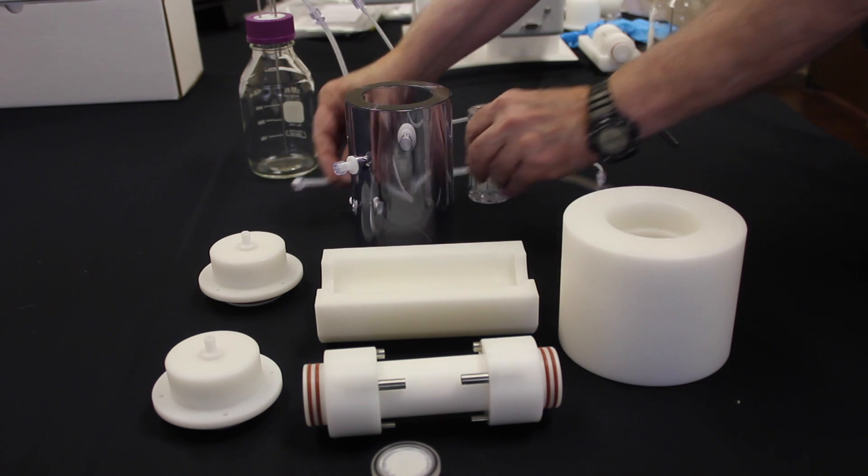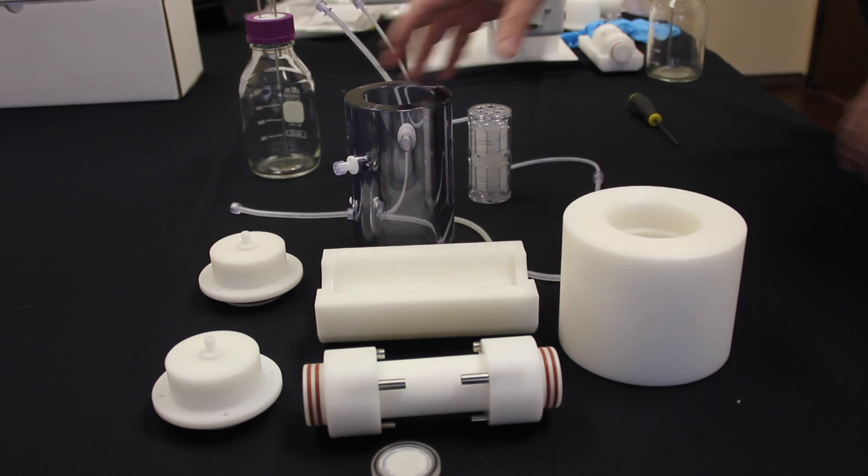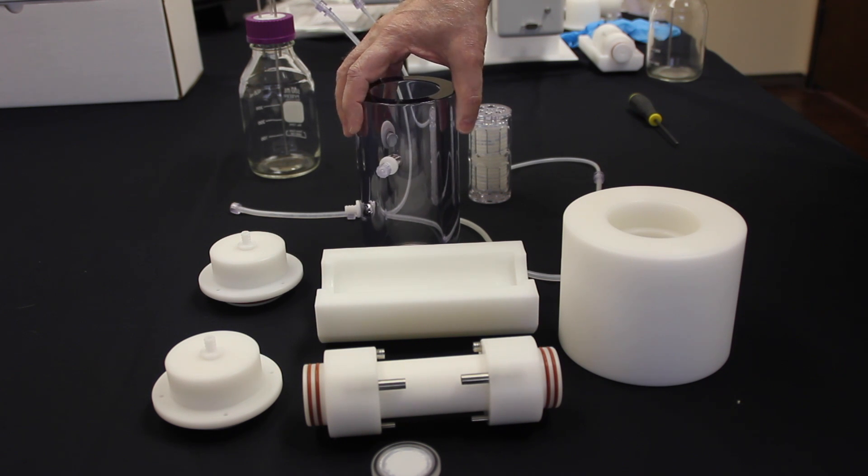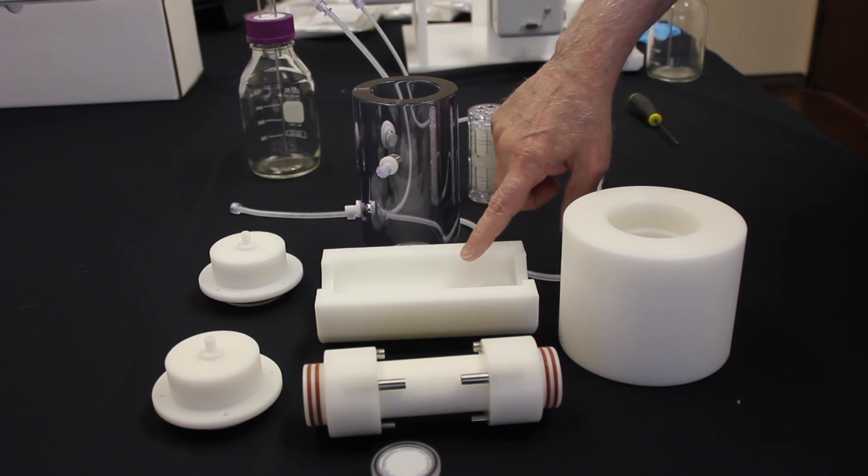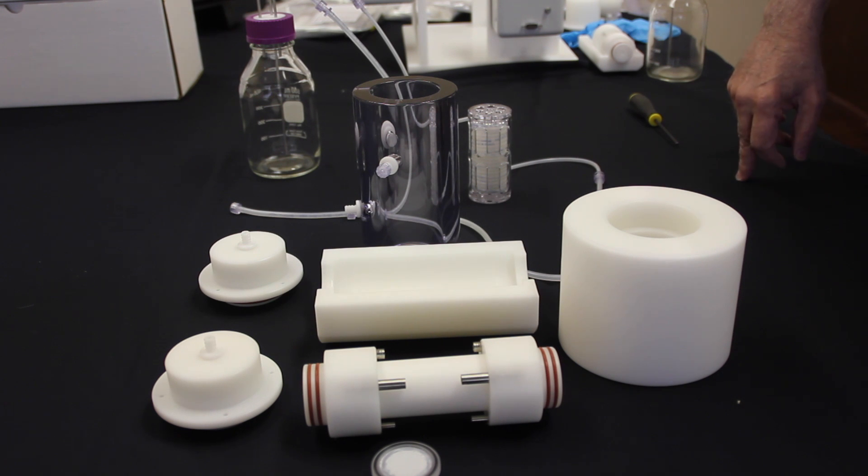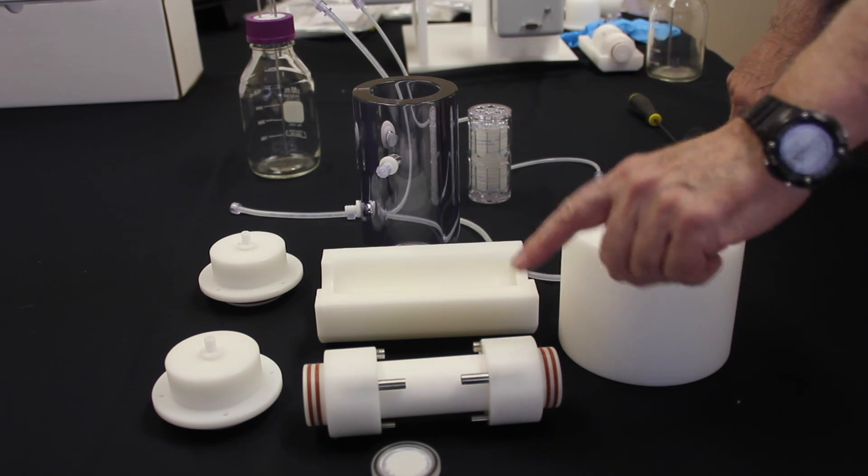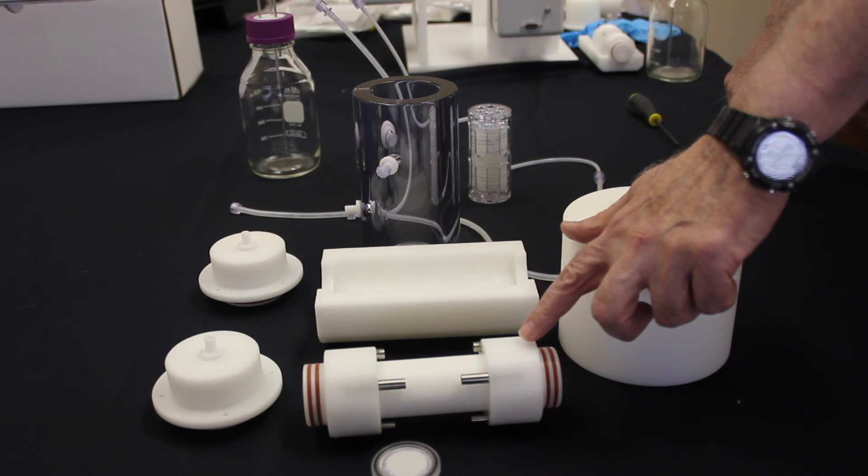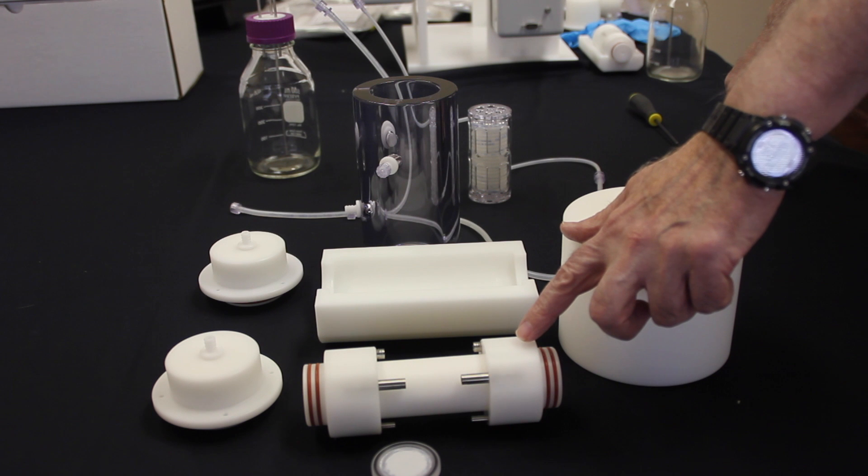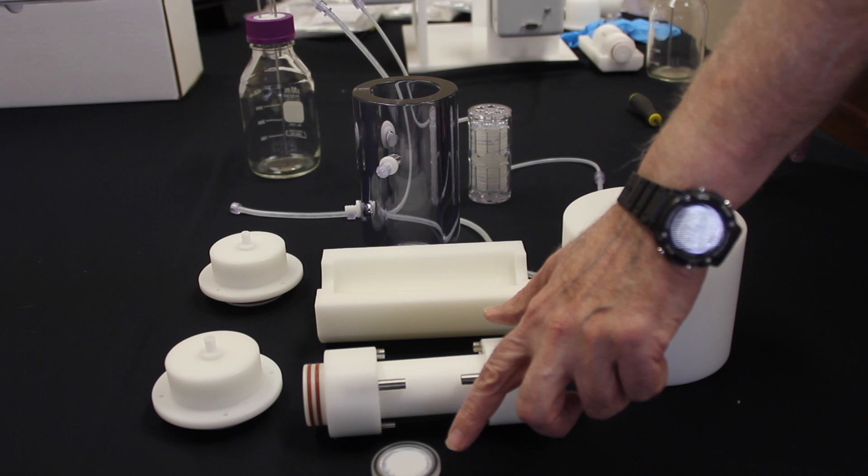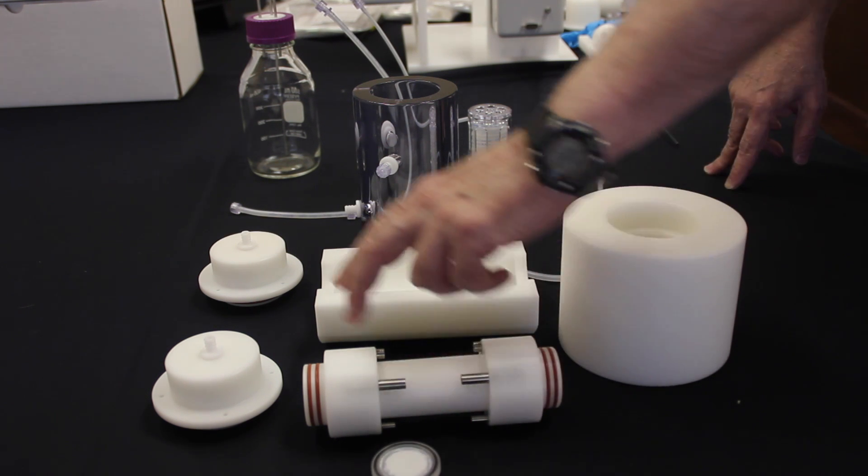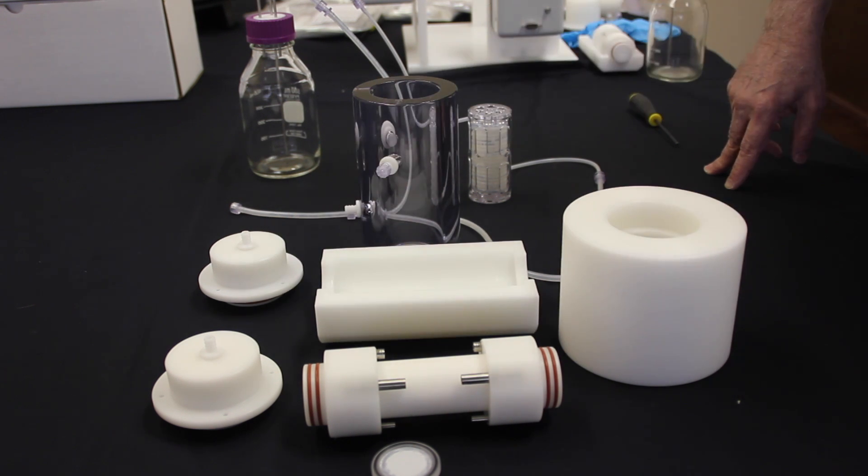Next, right in front of that we have the vessel wall that must be wrapped in foil or an autoclave bag and be sterilized separately. In front of that is the cradle used to prepare in the hood, also autoclaved separately in foil. Then we have the chamber where your vessels are tied on, also wrapped separately and autoclaved. In front is your spring-loaded filter, same story there, autoclaved separately, and the two end caps which the same thing is done with those.